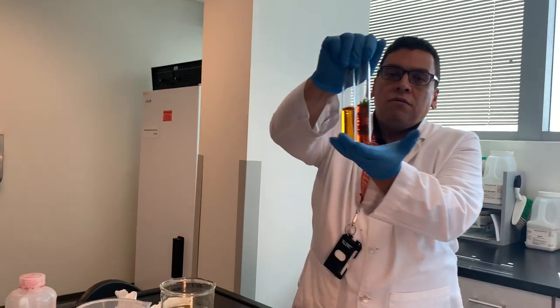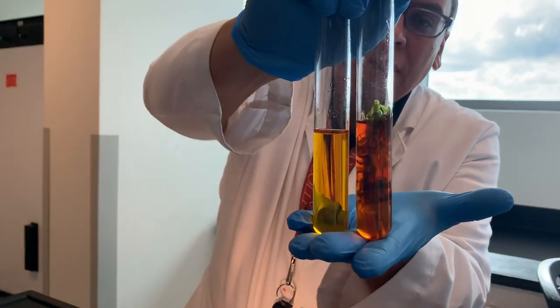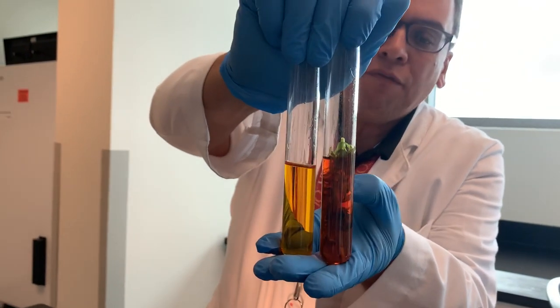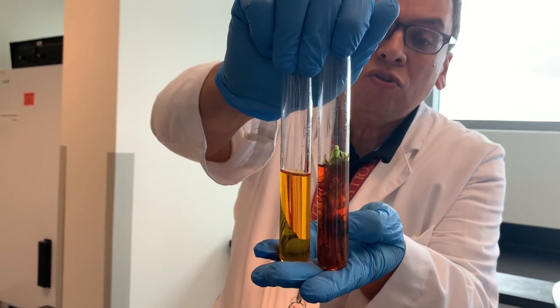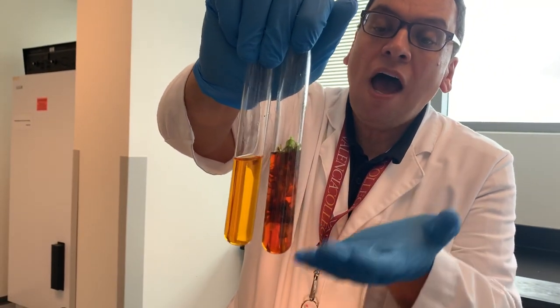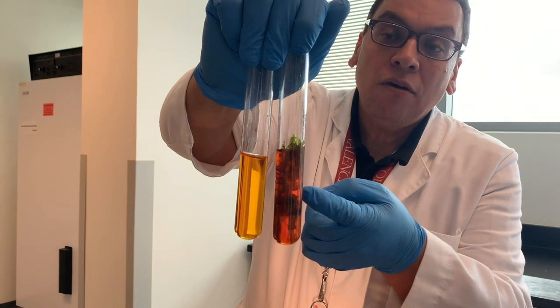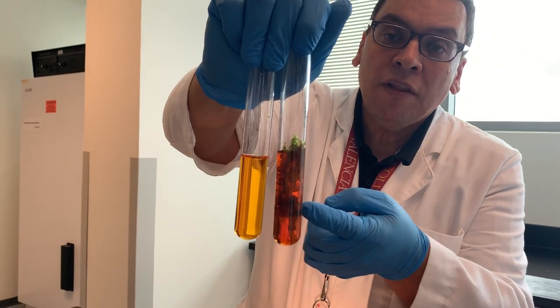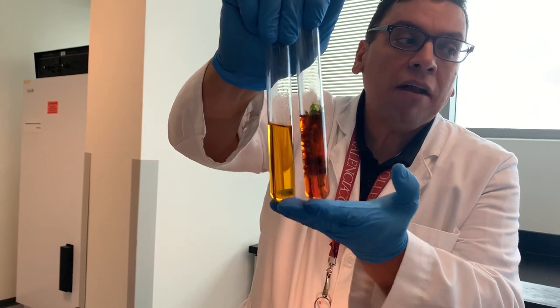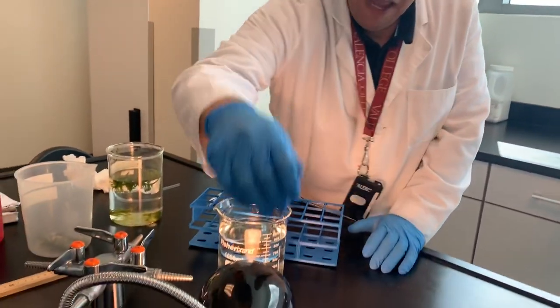The color came back to red because the plant consumed the CO2, took the CO2 out of the solution and made glucose with it. It brought the pH back up and the color turned back to red.